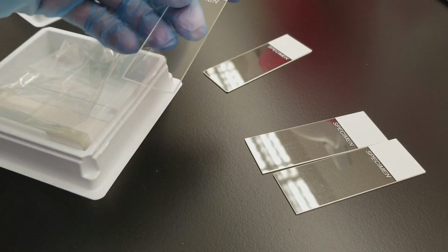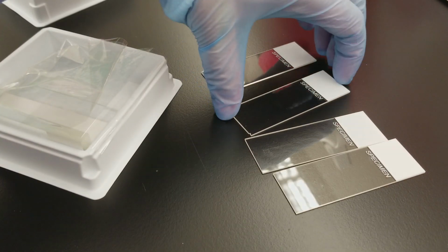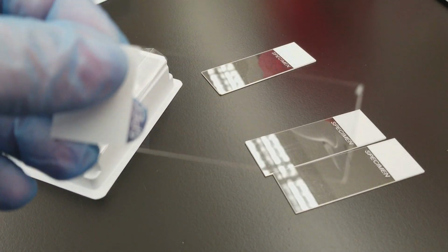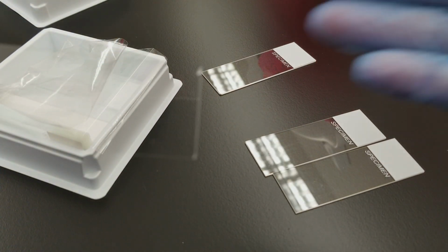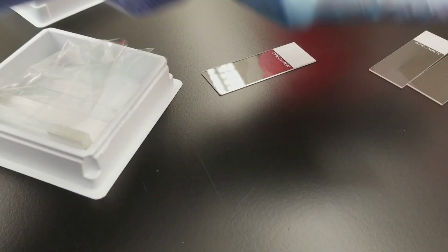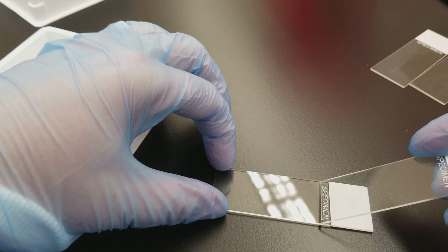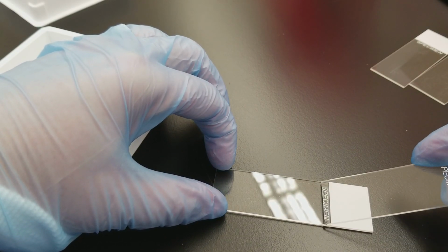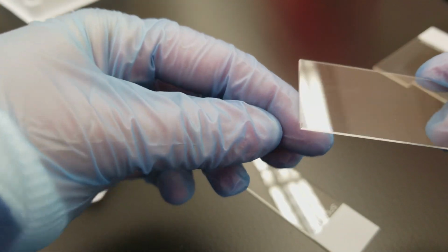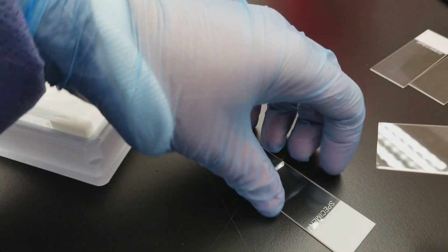Also, you're going to need a spreader slide and a slide that your specimen is going to be on. Knowing that, you want to make sure that you have clean slides, and that they're not chipped. See, this one is chipped. Now, if we were doing the regular way of doing a smear, you would be using this as a pusher slide. And if you have this chip here, then that's possibly going to draw a line in your smear, and you don't want that.